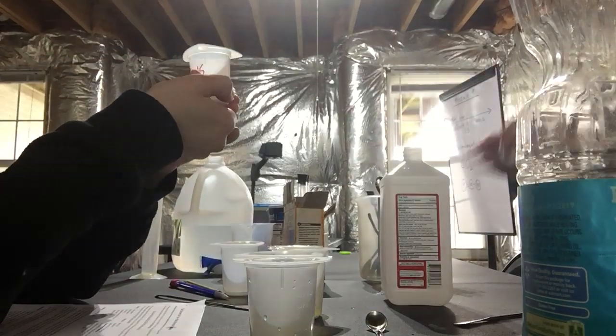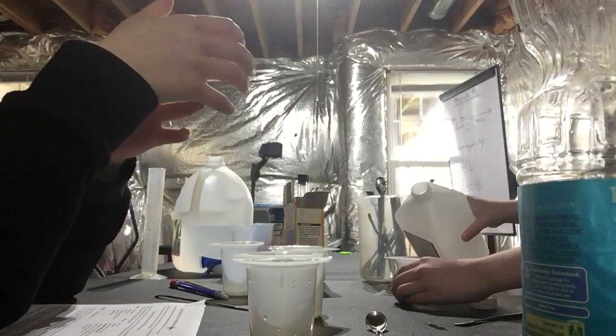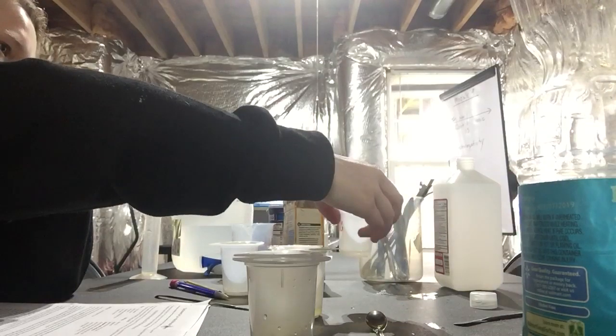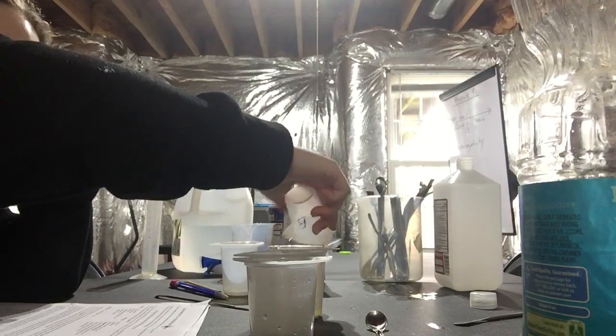Put 10 milliliters of alcohol in here. Last time you didn't trust me, but oh well. That's good. Oh, help me. Oh, the smell. Oh, the smell. Look, I got weird.